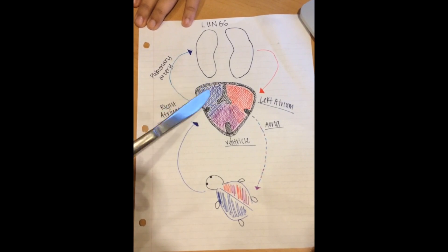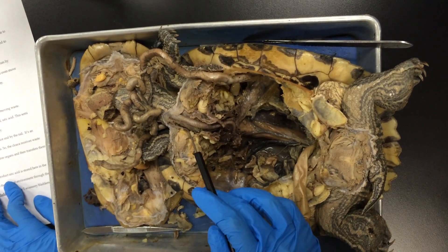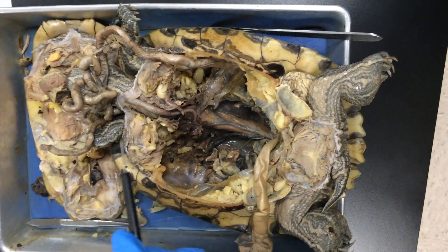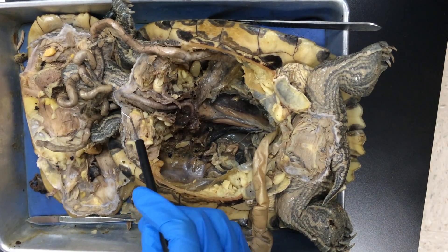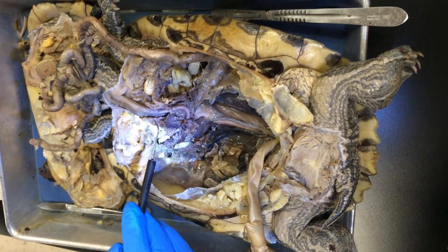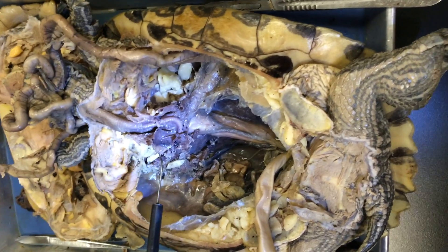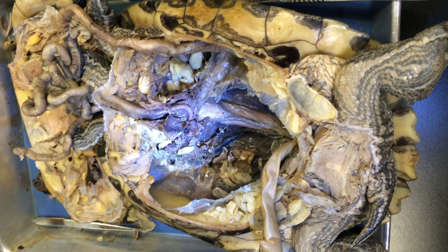Here's the trachea. It lies ventral to the esophagus. It has a ribbed appearance and is made of cartilage. Near the internal nares, palatal folds direct air into the glottis, and then the air is transferred via the trachea. The trachea is commonly referred to as the windpipe because of its function in the respiratory system. Here are the lungs — they're obviously deflated, but they're attached to the trachea. Respiration occurs by expanding the thoracic cavity to suck air into the lungs. Turtles will even move their internal organs to create room for an enlarged thoracic cavity.